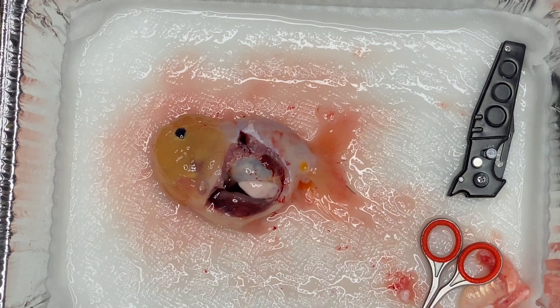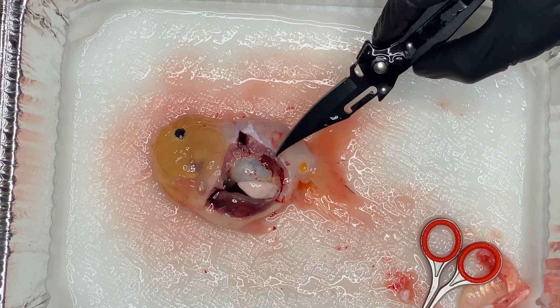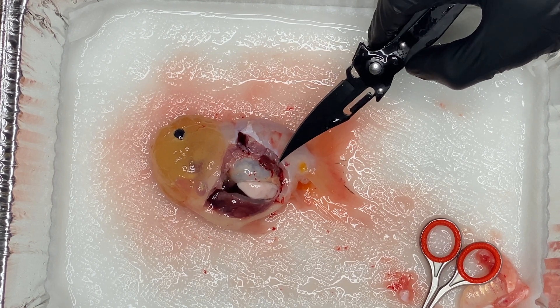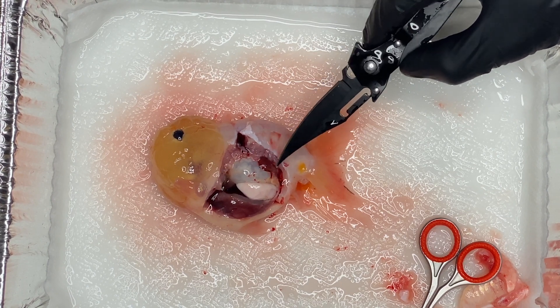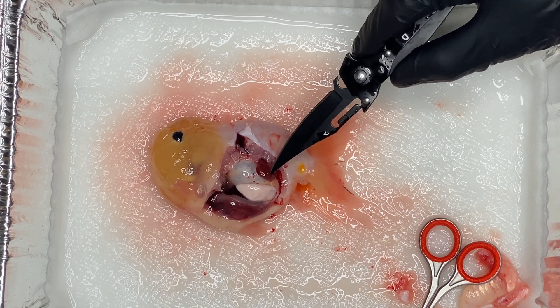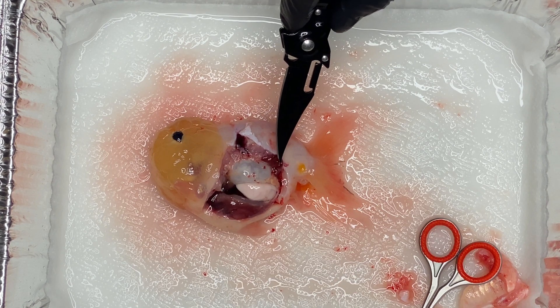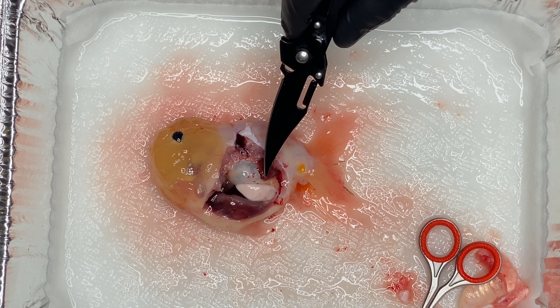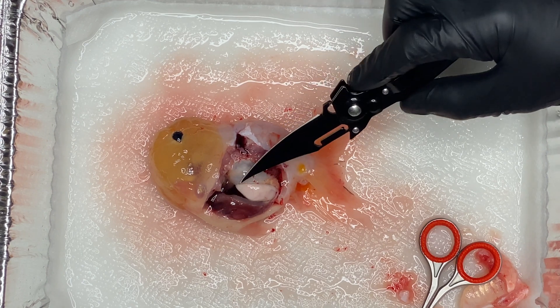I'm cutting to when I cut the whole side off so I could see basically a side view of where all the organs are placed. So if you look very closely at this little red thing right here, that actually is a kidney. So if your goldfish has dropsy, it's typically a problem with your kidney. You really can't do surgery on them to give them a kidney transplant or fix their kidneys. But if you have dropsy in your goldfish and they have trouble regulating fluid in and out of their body, it is basically because of this kidney having trouble regulating that amount of fluid.